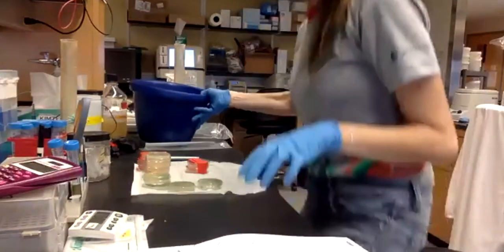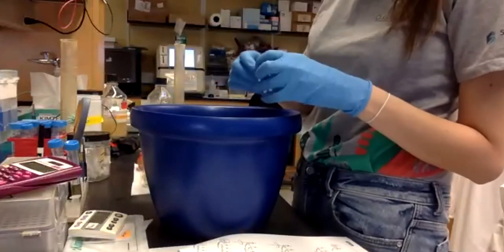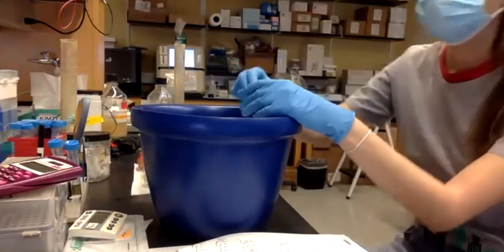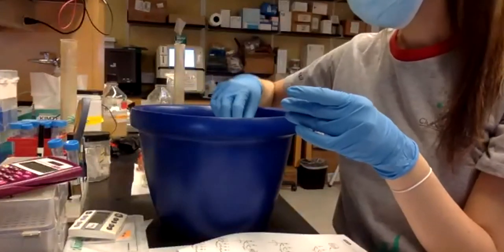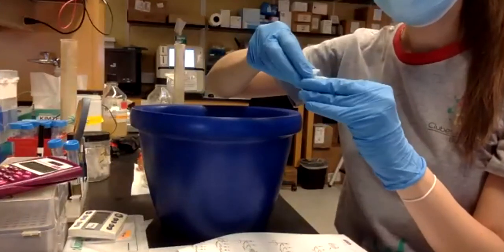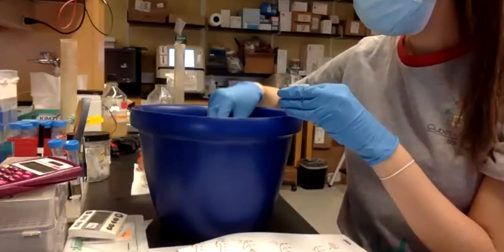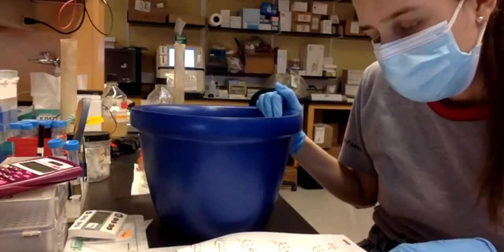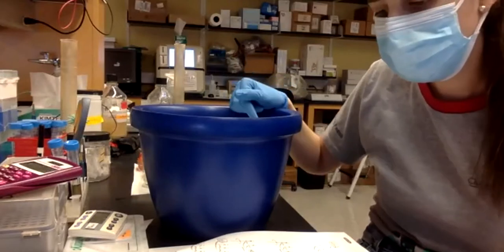So here, what I have done is I have labeled tubes A, B, C, D. Remember what we had in my slide? We will go back to that, but I labeled these tubes. When we were asking what will happen in tube A, in tube B, in tube C, this is why I labeled them exactly like that. And I'm just going to do the transformation. Okay, so I'm going to follow the protocol. It says label 4 tubes from A to D, which I already did.